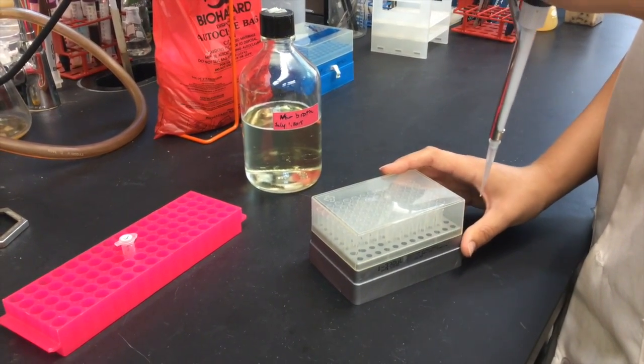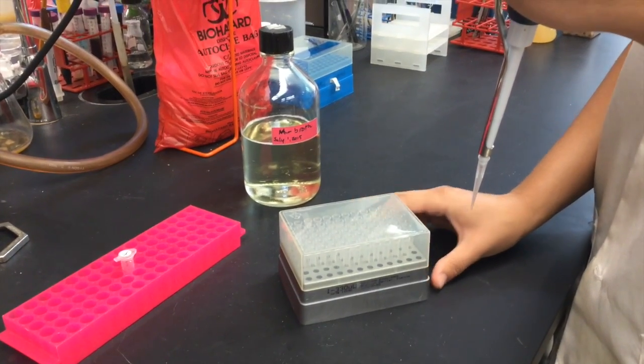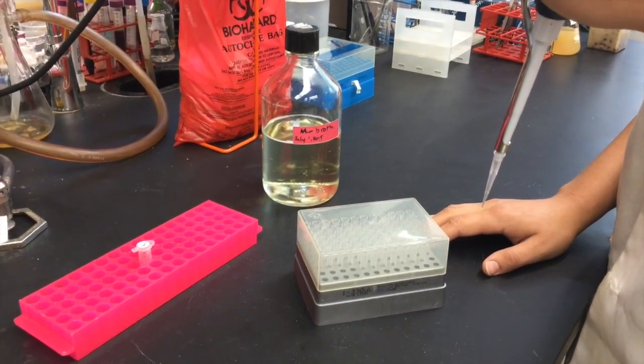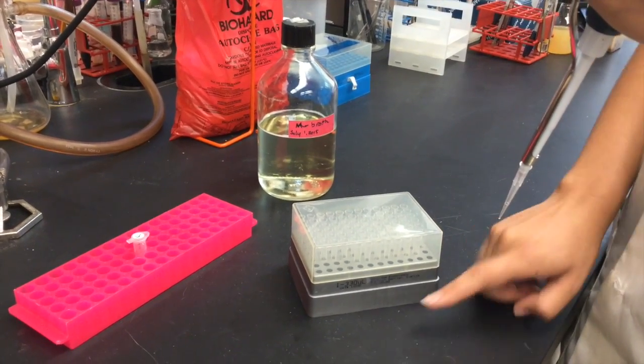Since we are working with a sterile tip, do not touch the tip to anything or set it down on the bench. Also, don't forget to check the size of the tip to make sure you are using the proper ones.